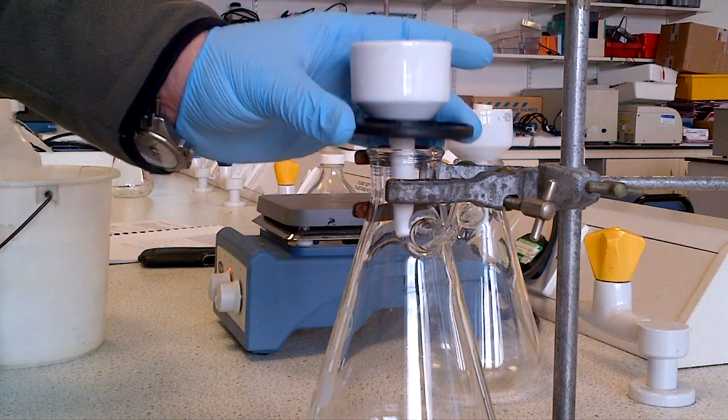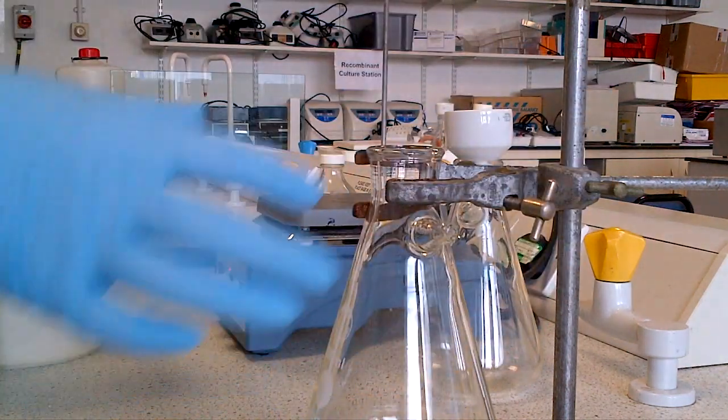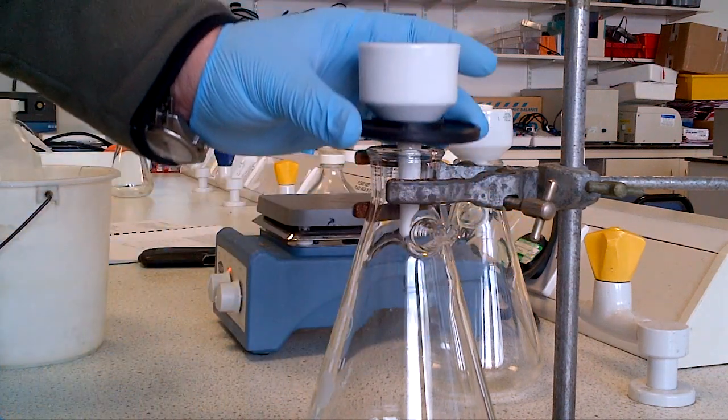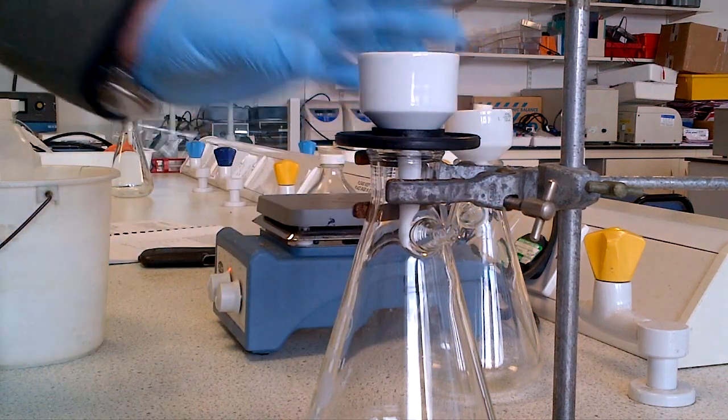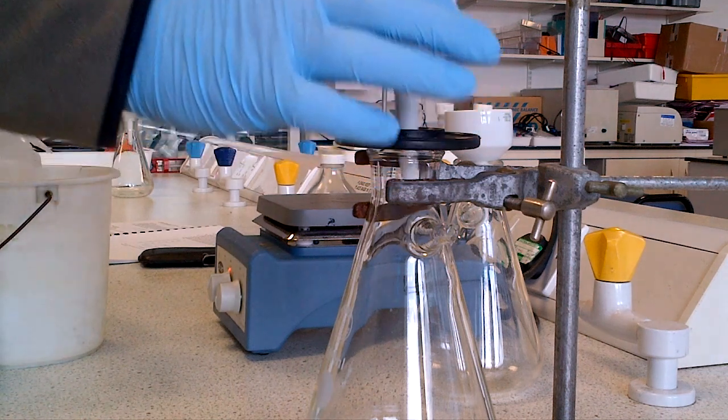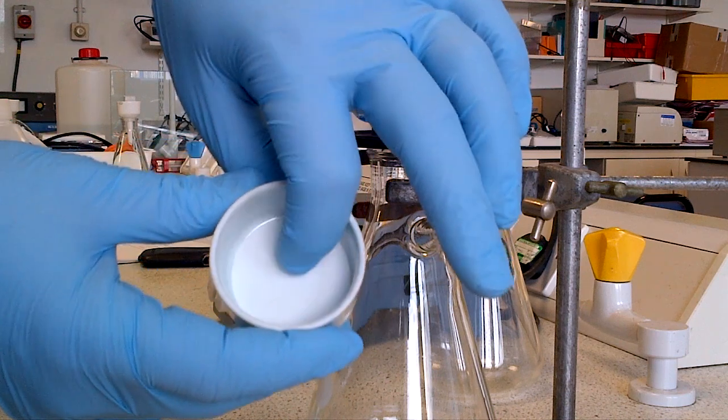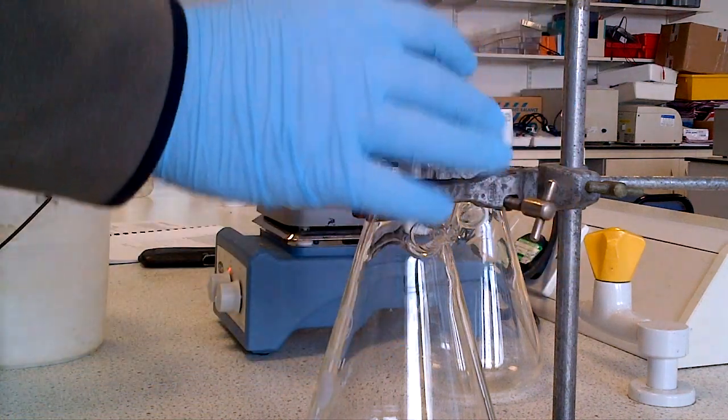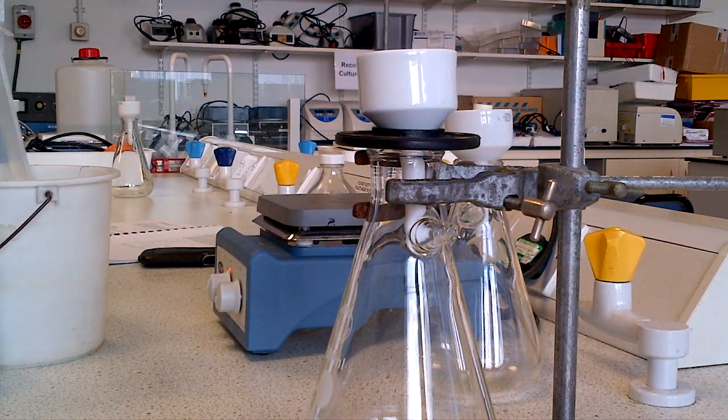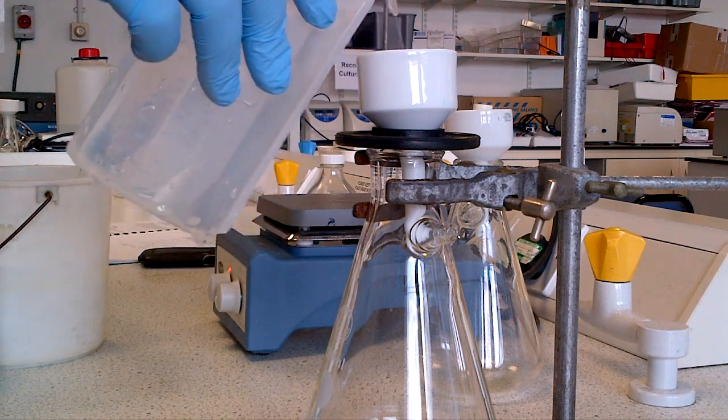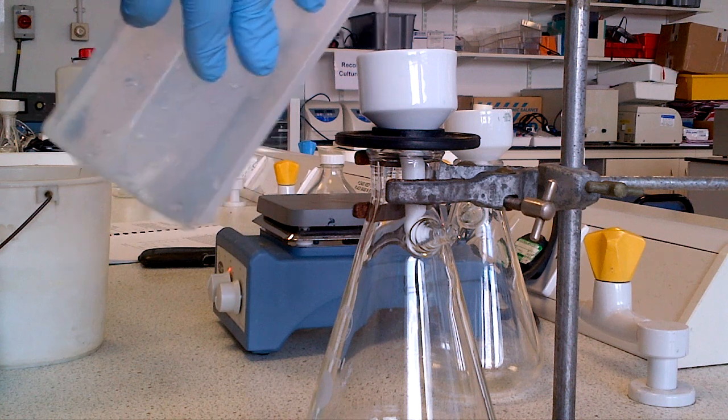You place the o-ring over the top and then place the filter funnel in position. Note that I've clamped the apparatus together so it's firmly secured onto the bench. The funnel contains filter paper inside that needs wetting down in position by the use of cold ice water.